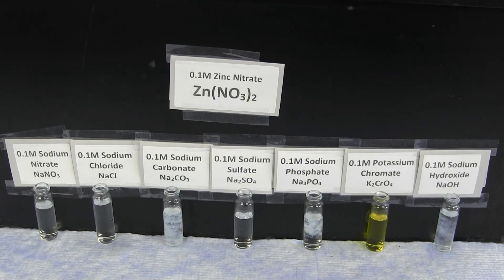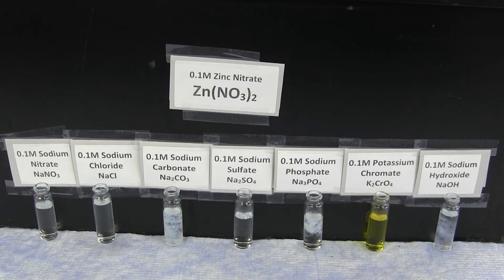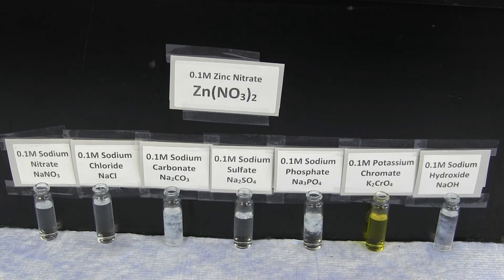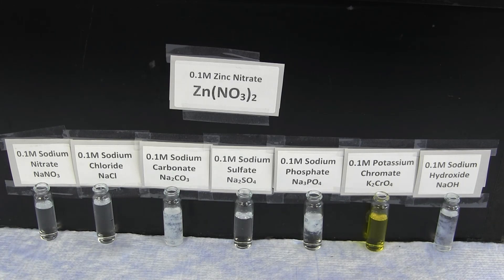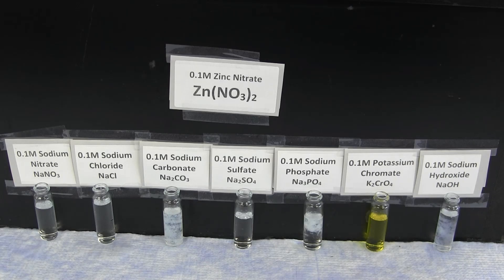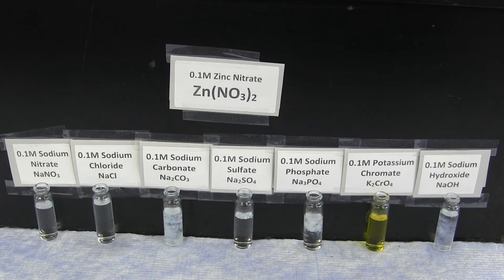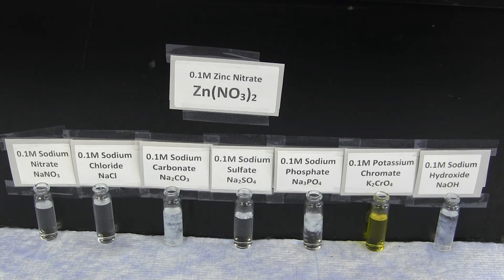Overall, the zinc ion forms a white precipitate with sodium carbonate, sodium phosphate, and sodium hydroxide. There is no reaction with sodium nitrate, sodium chloride, sodium sulfate, or potassium chromate.